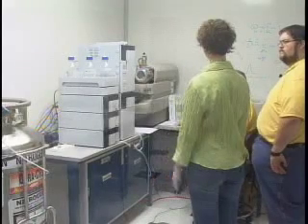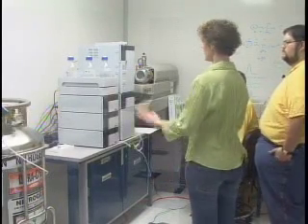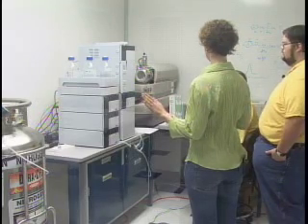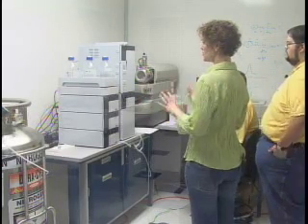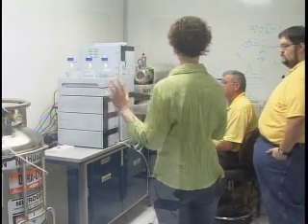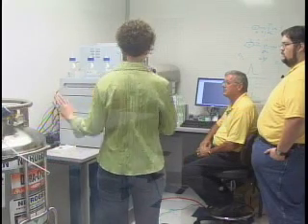This is a hardware introduction covering the basic system from start to finish. The system includes a gas source — in this case a dewar of nitrogen, but it can also be a standard gas generator. The nitrogen source is introduced into the mass spec, which we'll get to in a moment.